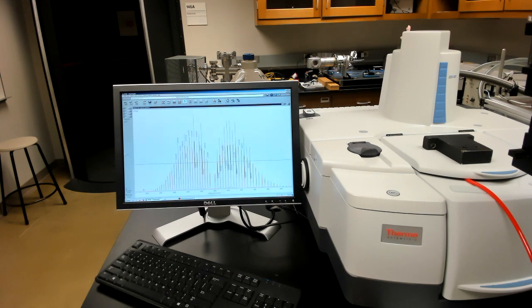There are two controls to the peak finder. One is a threshold, which looks like this black line here. If I make the threshold lower, then more of the peaks will show up. The second thing is a sensitivity control. Here it is. If I increase the sensitivity, more peaks will get labeled. However, if I make the sensitivity too high, then all the little noise features will get labeled. We don't want that. So we'd like a sensitivity about here.